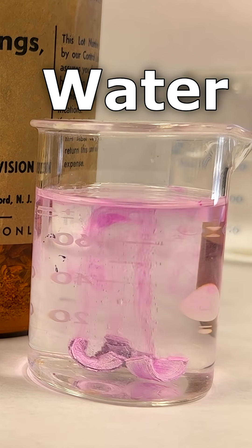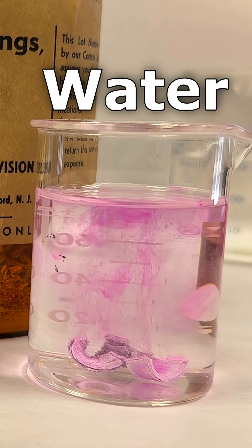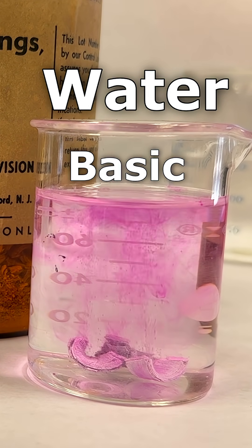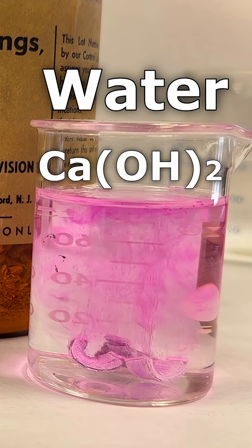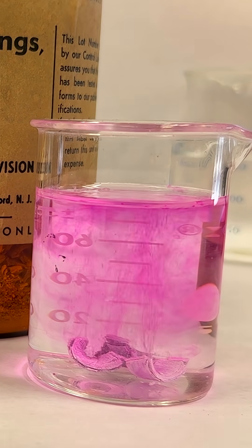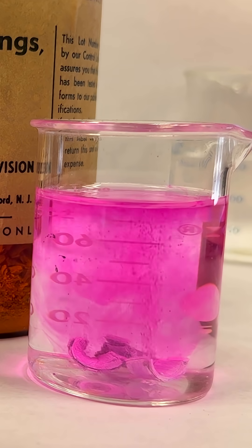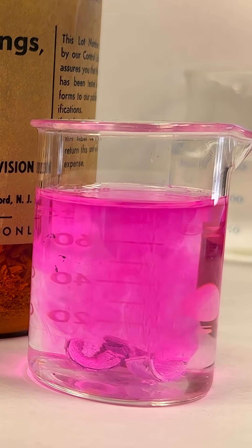Now this one's turning pink. So what does that mean about the reaction? It's becoming basic. So this is making calcium hydroxide over on this side. And because it's making a hydroxide, it's getting rid of a hydrogen. Where do you think that hydrogen's going? What do we see coming off?